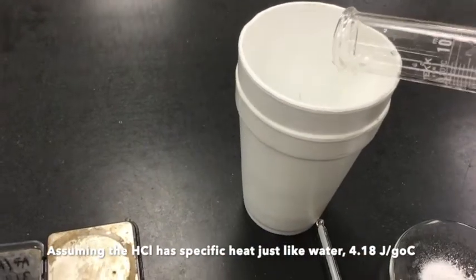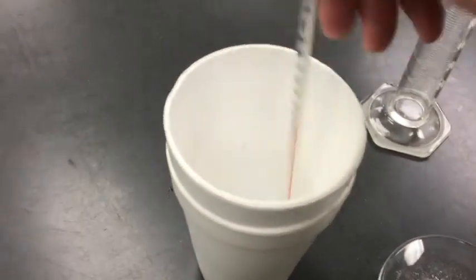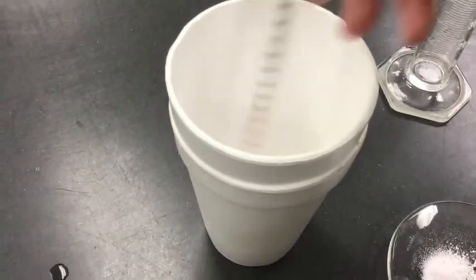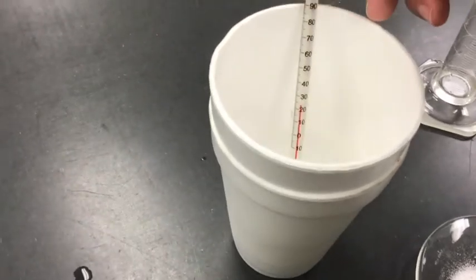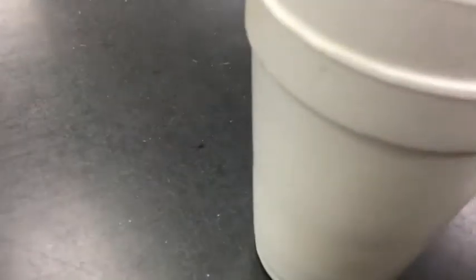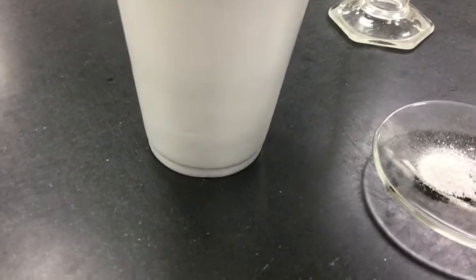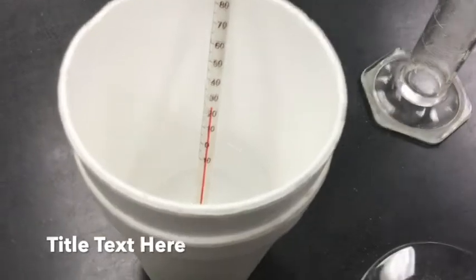So I'm going to take that hydrochloric acid and put it into my very fancy calorimeter that is here, and then put in a thermometer and stir that around and make sure that I get an accurate temperature for my hydrochloric acid so that I know where it's going to start. And it looks to me like it's starting, again, you can't really tell from where you are, at about 23. So I'm starting at 23 degrees Celsius.